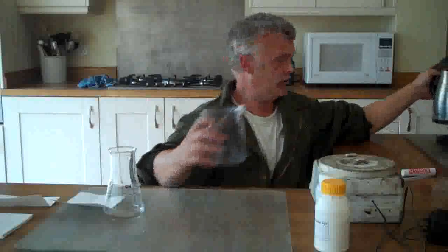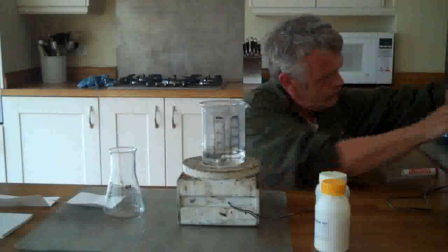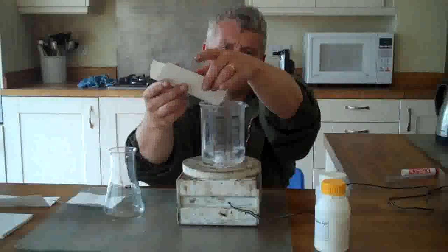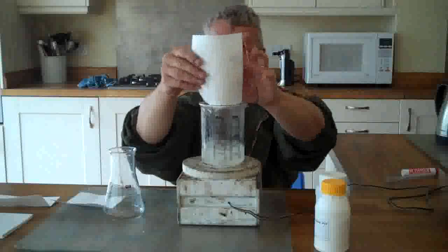The first thing you need to do is dissolve your PVP into some water. We're going to do this reaction with the water hot, because it helps speed everything up. Take 100 millilitres of hot water, put it on your stirrer, and add your PVP. The amount of PVP I'm using is a 0.8 molar amount.